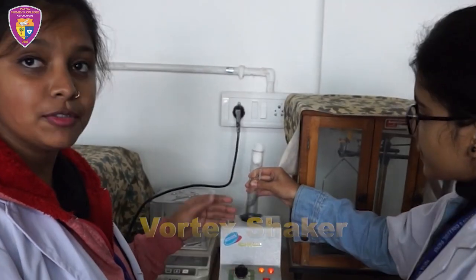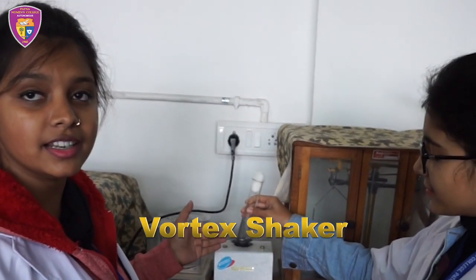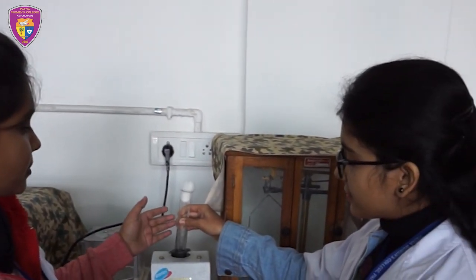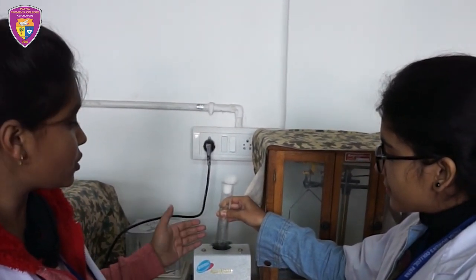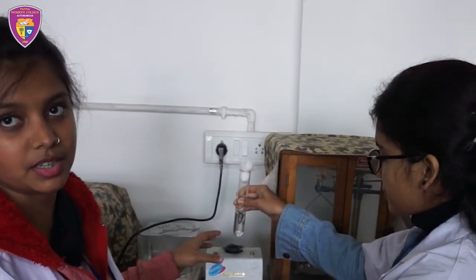This is an instrument known as a vortex mixer. It is used in the laboratory for mixing sample vials of liquid. It consists of tubes and microtubes of 30 mm diameter, and is also used for homogenization and cell disruption.